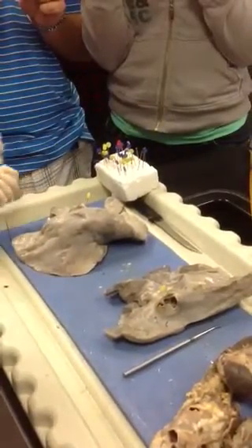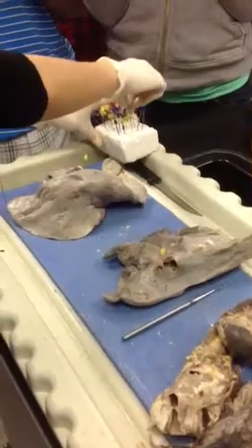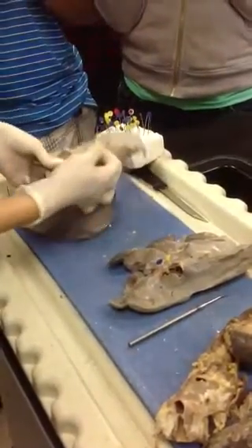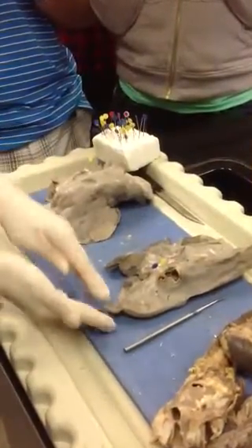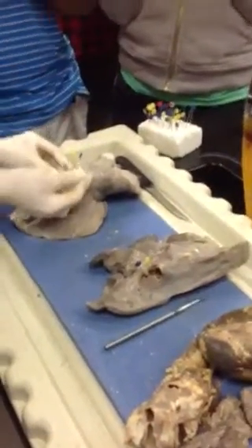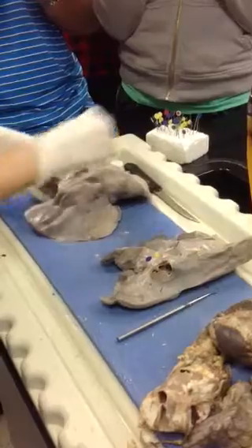Now, since we just went over vessels, which has the thicker tunica media? Arteries or veins? Arteries. Arteries. So, the arteries will be superior to the primary bronchus. See that? Superior, inferior, superior, inferior. Right? So then the veins will be really thin in comparison. And normally you'll find them inferior to the primary bronchus. So you can see the difference there.